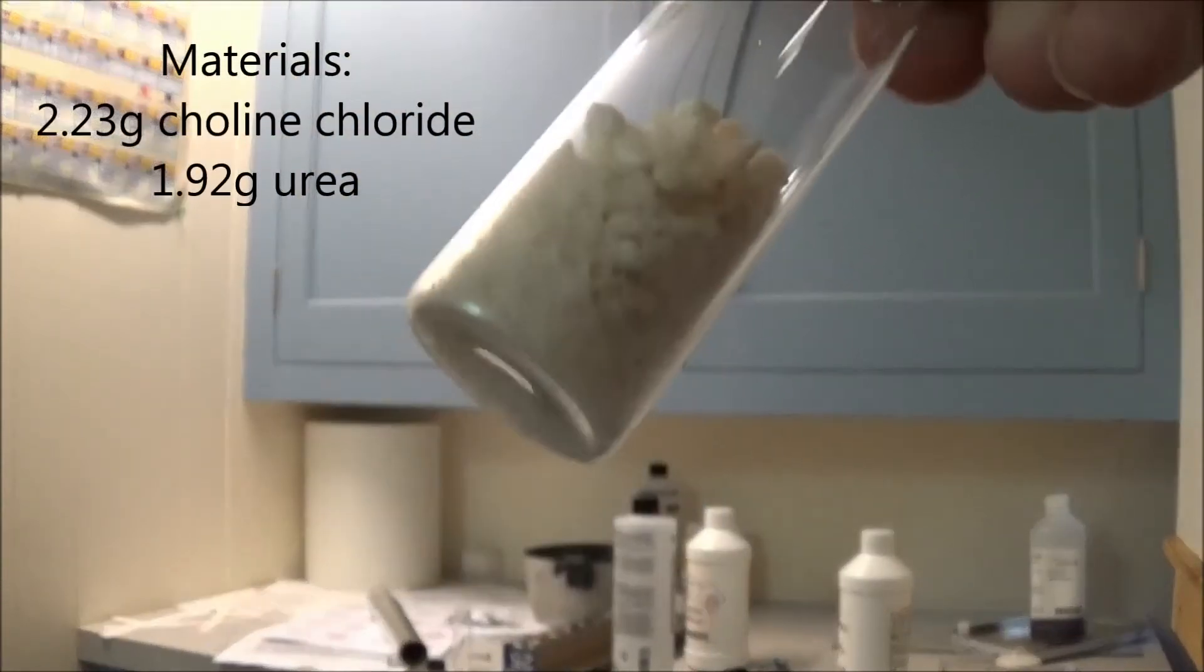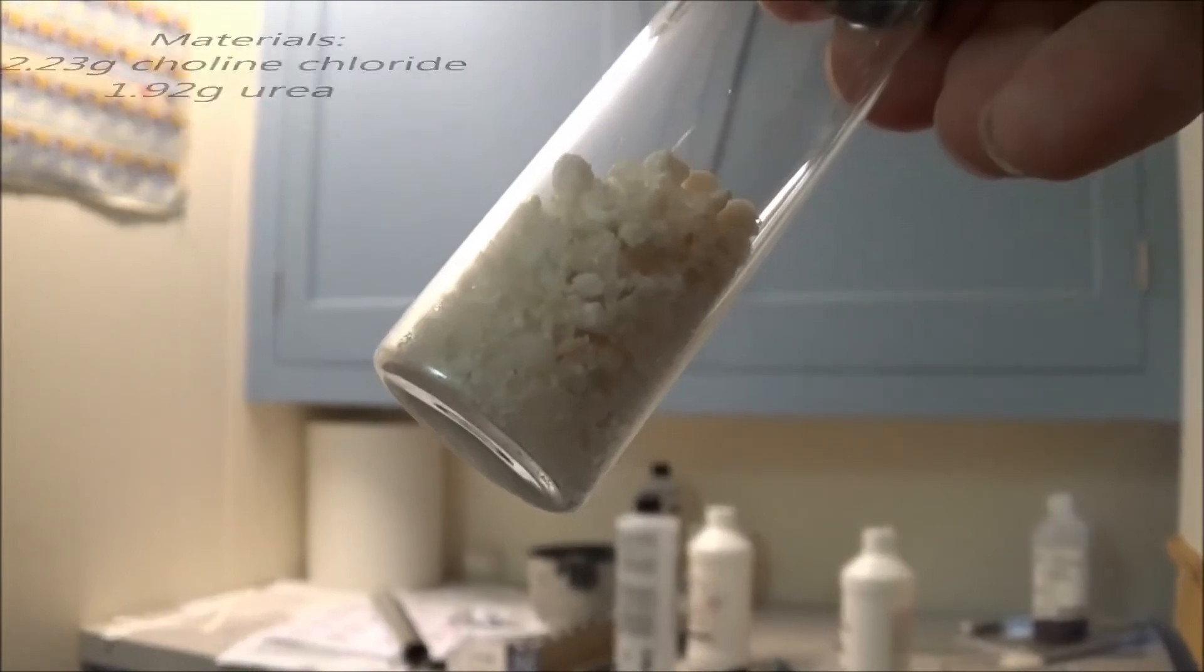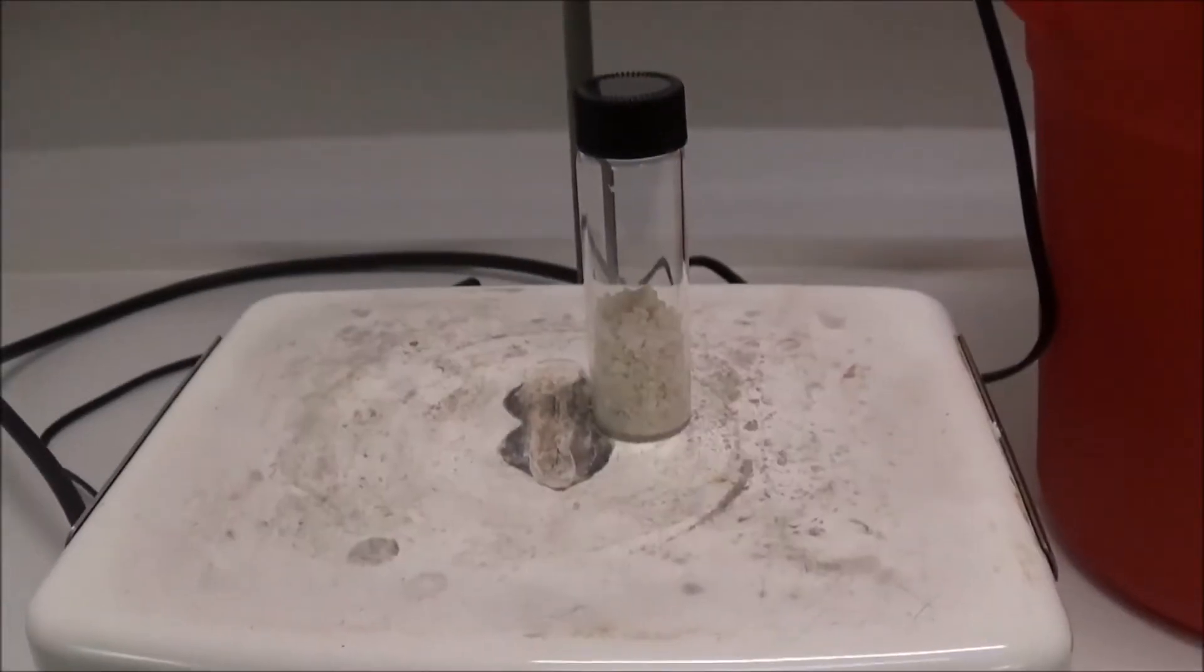First, anhydrous choline chloride and urea were mixed together in a 1 to 2 molar ratio inside a glass vial.